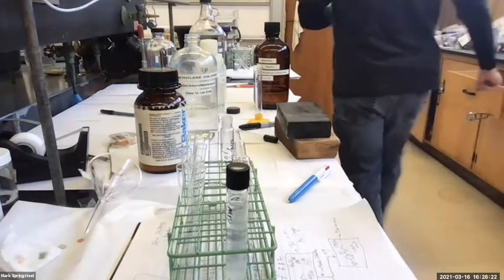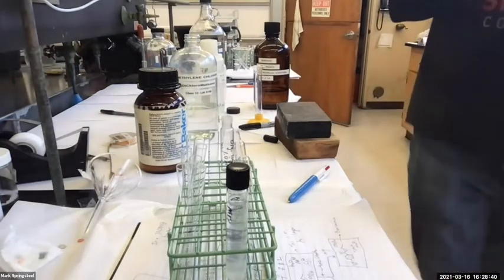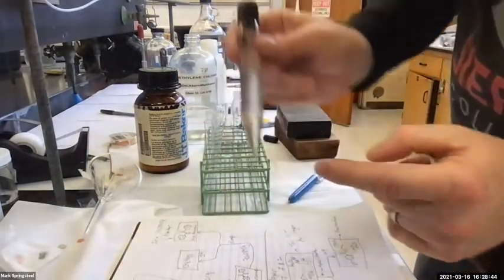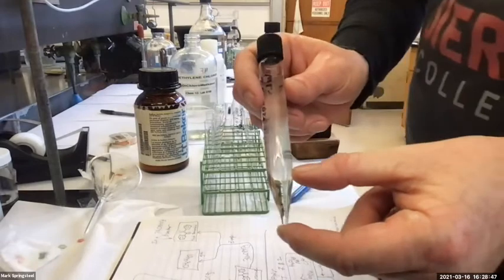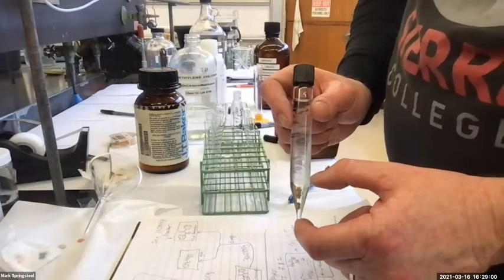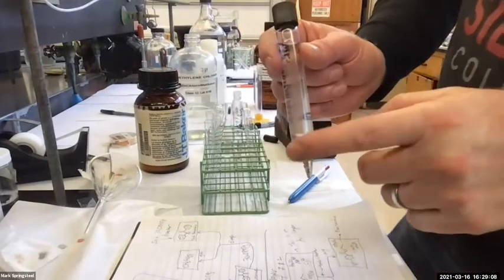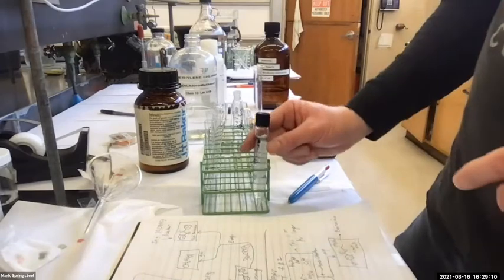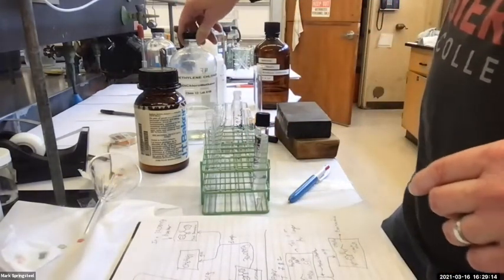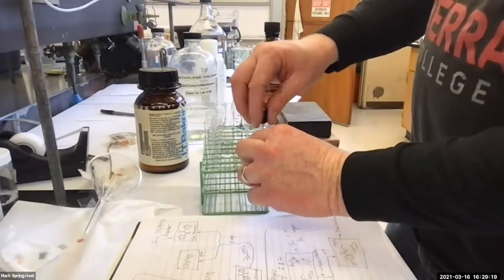I got a little methylene chloride and pen on my hands. I'm gonna wash that off. Okay, so I should have the bottom layer be what, aqueous or organic? Methylene chloride on the bottom, or is that water on the bottom? Should be the methylene chloride. Methylene chloride's our most dense organic solvent we use, so density like 1.33 grams. So that should be on the bottom, and I'm gonna pipette that out.